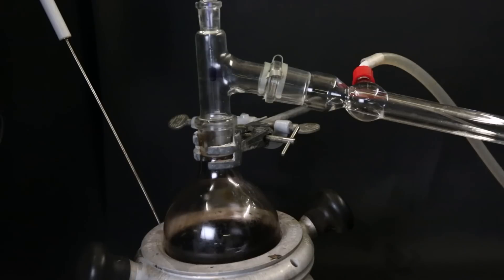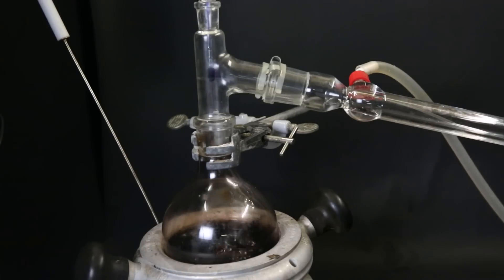After that was done, we should now have a mixture of hexane, THF, and cobaltocene. And maybe also some DMSO that came along. Though it is immiscible with hexane, it is miscible with THF. Now hopefully, I can simply boil off all of the solvent under a vacuum, and I should then be left with the cobaltocene.